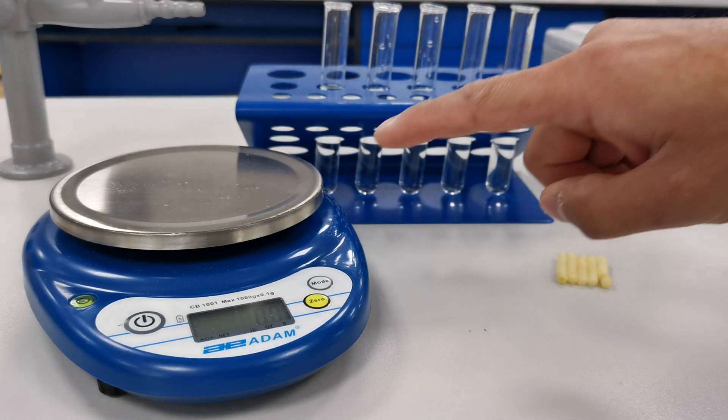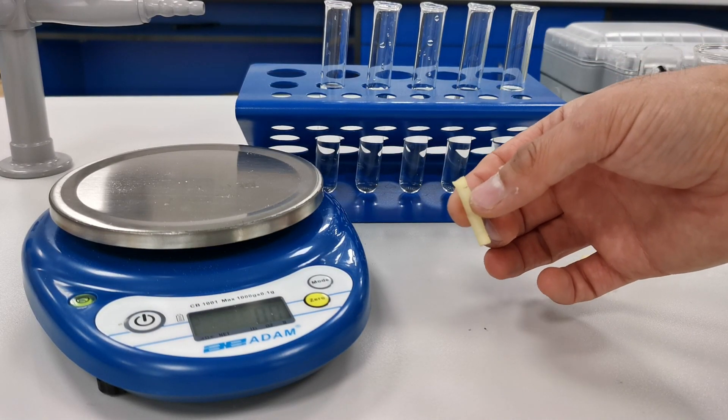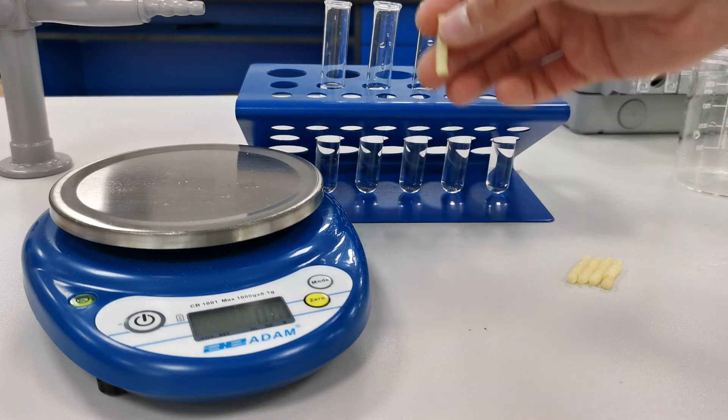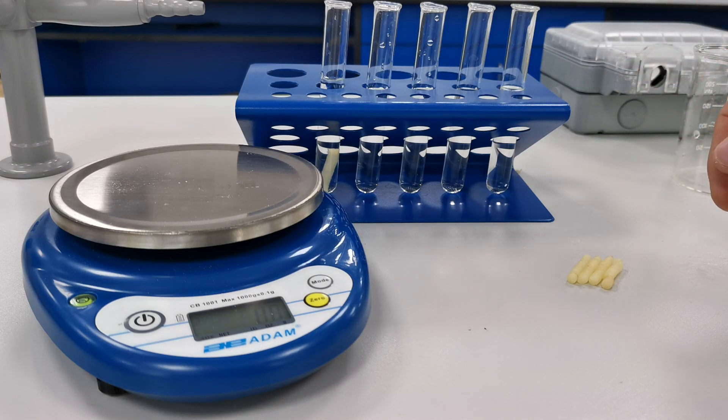I'm then going to use the mass balance to measure the mass of each of these potato cylinders. I'm going to record the mass on a table and then I'm going to put the potato cylinder into the solution and leave them there overnight for twenty-four hours.